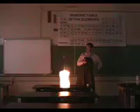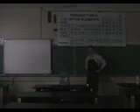Okay, here we go. I'm going to light the match. I'm going to hold the match over the opening. And we may or may not get the desired effect when I hold it over the opening. If we don't, I'm just going to let go and drop the match in there. At that point, we'll definitely get the desired effect. So without further ado, here we go. Just going to hold it. Boom. Voila. There we go.